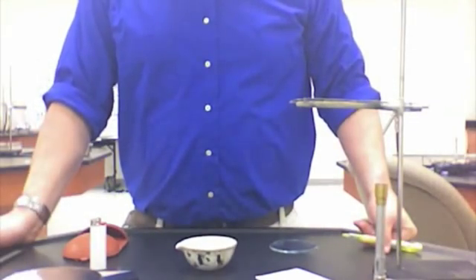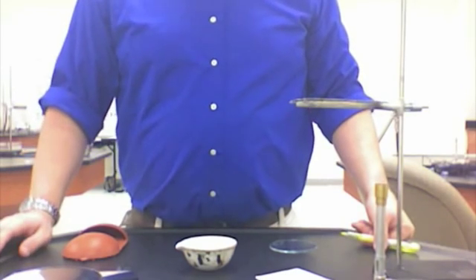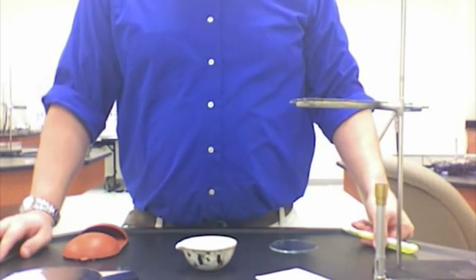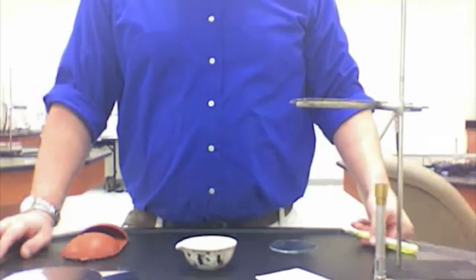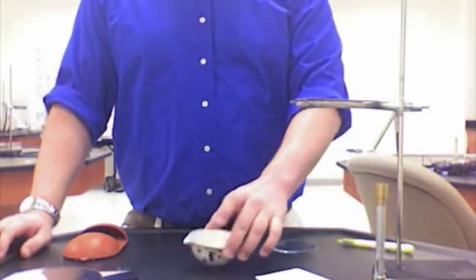All right guys, we're going to get started doing the mole to mole ratio lab on page 816. Before we start the lab, we're going over the materials that we need.